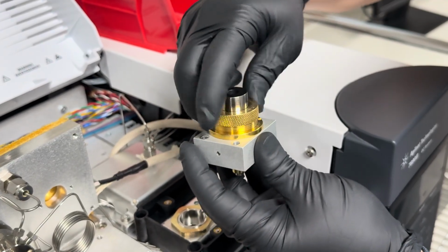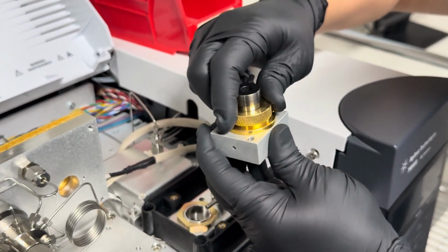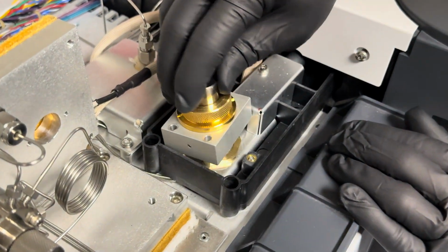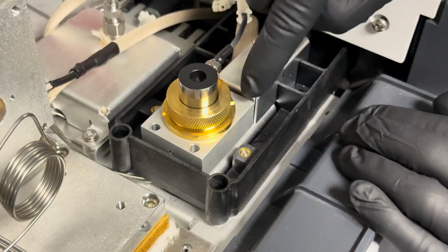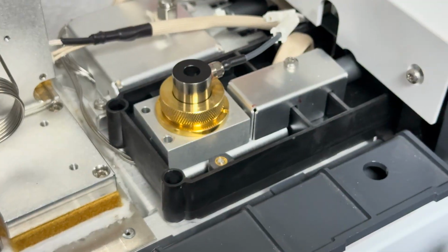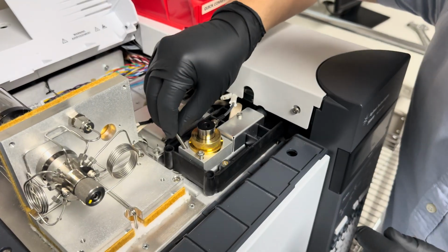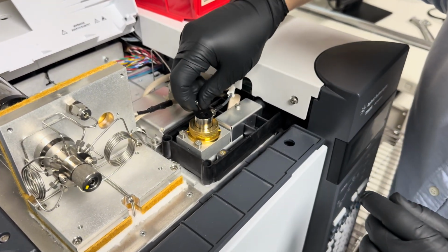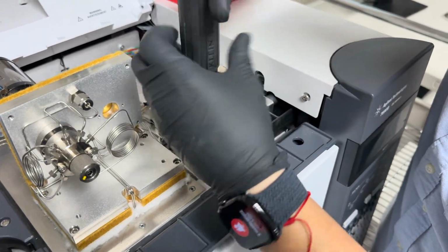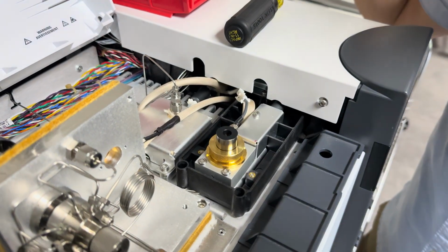and turn this to the right to tighten it. And you don't need to put a wrench, just hand tighten. And then when you put this back on, you just have to be gentle to have that spring kind of sit between the insulator inside of the collector there. And then you just put the 3 screws back on. And connect your igniter again, and that's it.